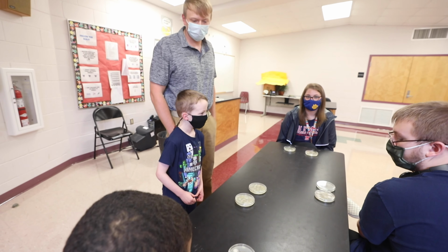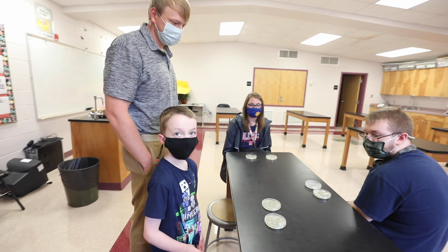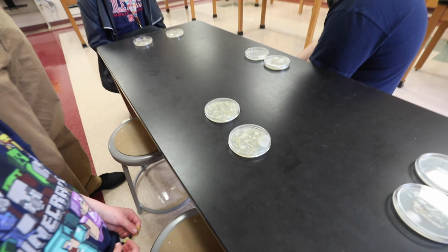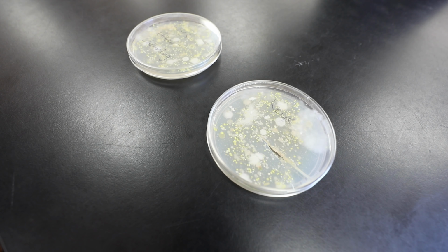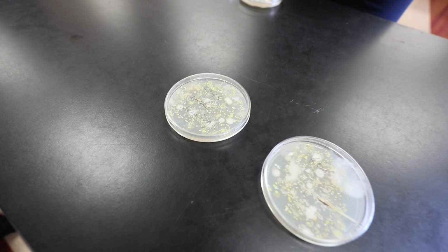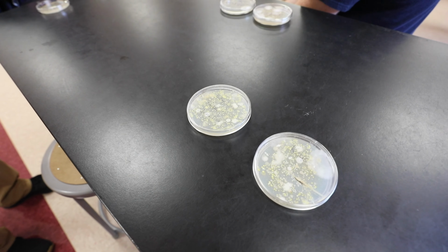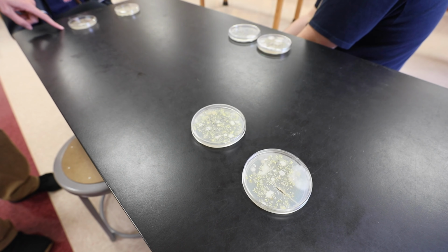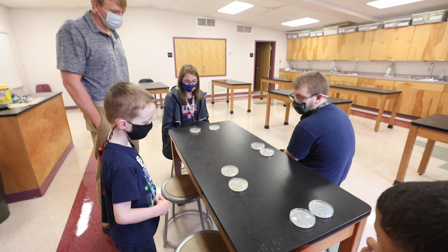It's a lot less growth on the tray after he cleaned it, correct? Same with you, the cell phone. You obviously did a good job, but the cell phone's easy to clean. It's a flat surface. It was very easy to clean. The computer was probably a lot harder to clean because with the keys, you got to try to get down in between them, so it's almost impossible to clean a keyboard as well as you could clean a cell phone. And as a result, you can see there's definitely less growth here, but it is more growth than some of the other ones.